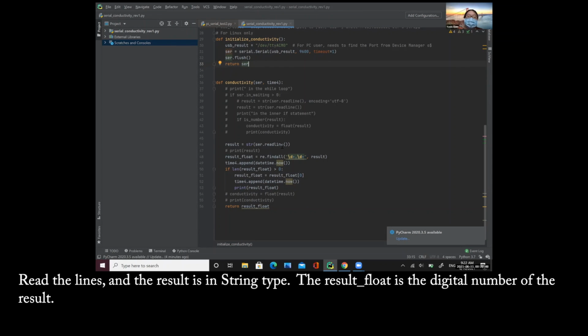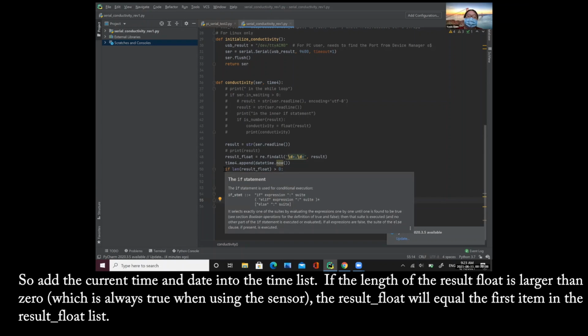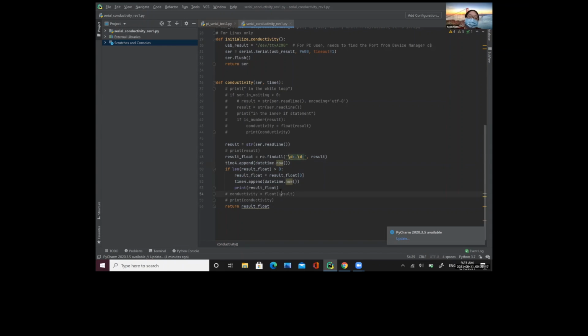Read the lines, and the result is in string type. The result_float is the digital number of the result. So add the current time and date into the time list. If the length of the result float is larger than 0, which is always true when using this sensor, the result_float will equal the first item in the result_float list.